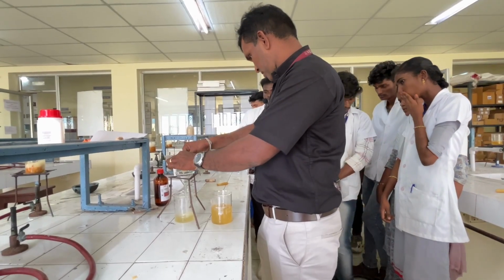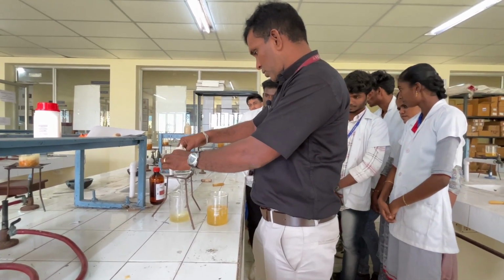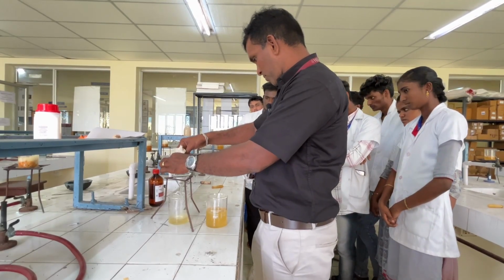So like this, repeat this process until you get a sufficient amount of pectin.